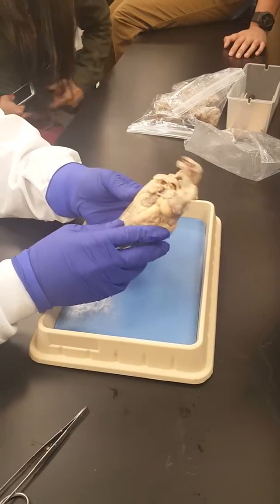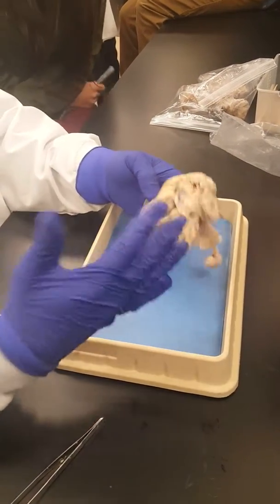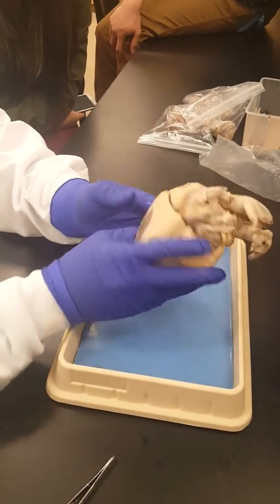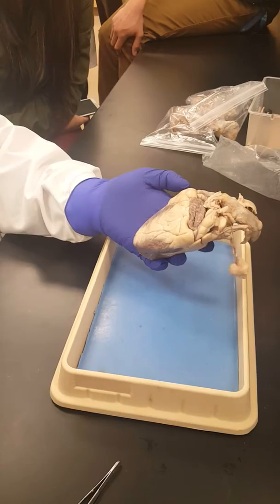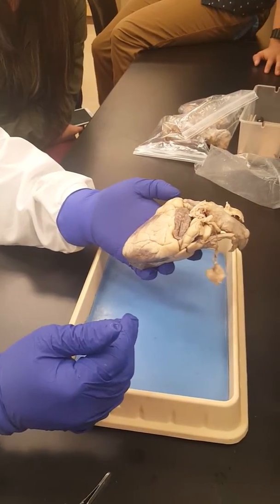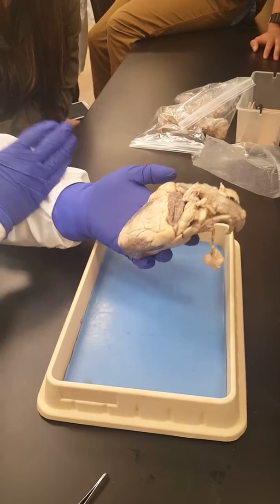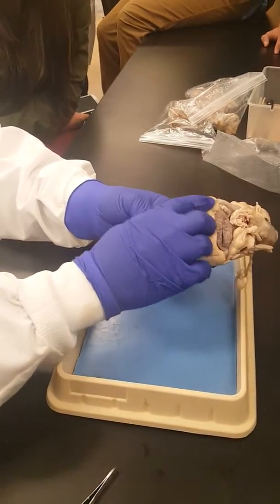We do the heart first. So the first part of the deal is to locate the anterior side of the heart, so that you locate the side that is facing your chest when in the body. We said one of the first things you do is use that interventricular groove, sometimes called interventricular sulcus, and it must be sloping from the top right to the bottom left to show that this is the anterior side.